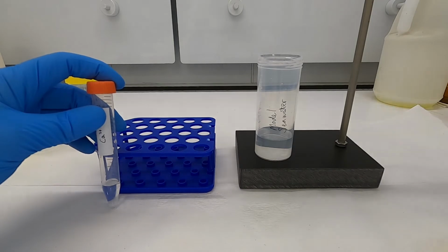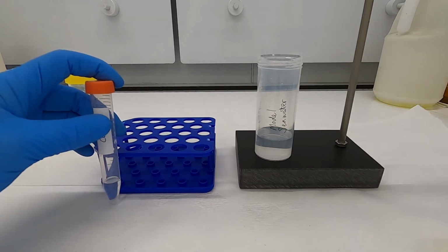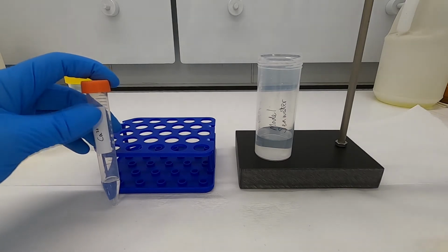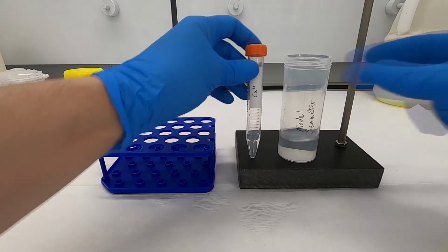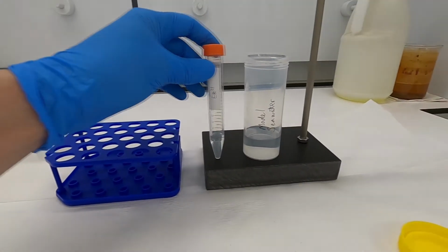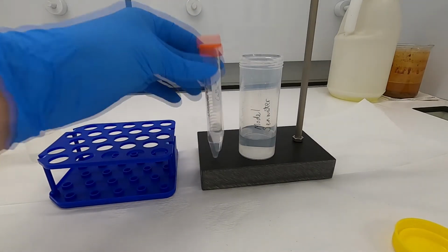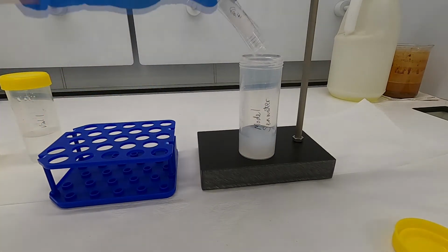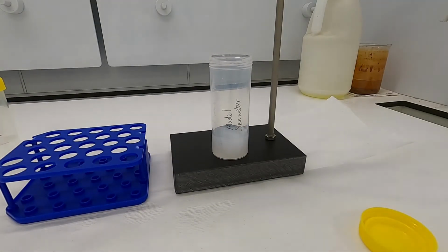And these include a whole range of organisms, such as shellfish, even coccolith phytoplankton, which are absolutely vital for the production of oxygen for our atmosphere. Okay, so we can see from both of these solutions, they are transparent and clear. So whatever's in there is fully dissolved. When we combine them, you should see a lovely white precipitate in the model seawater.